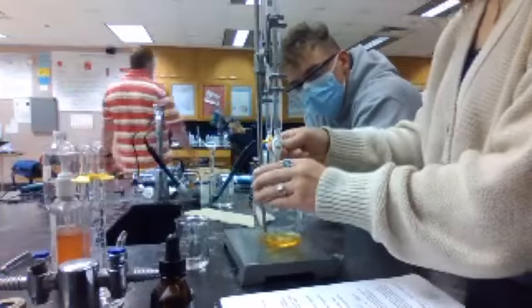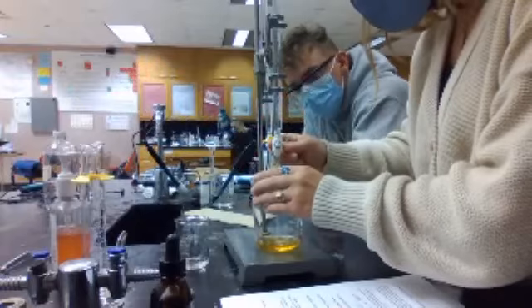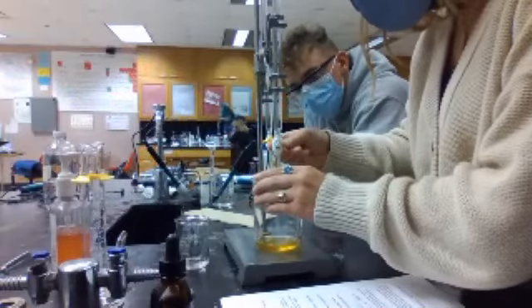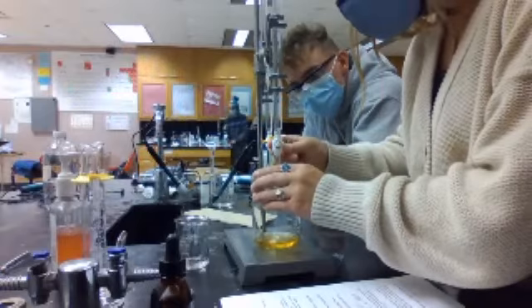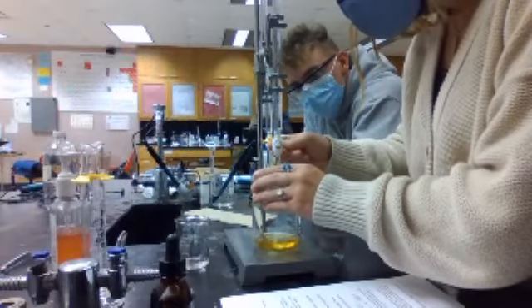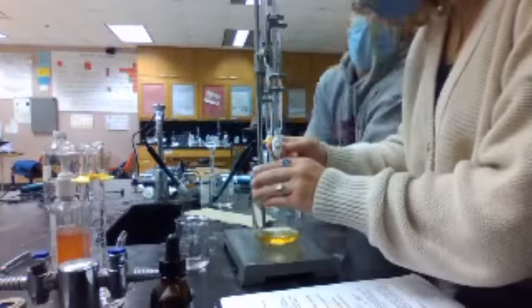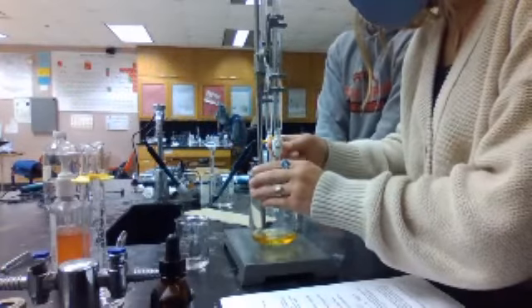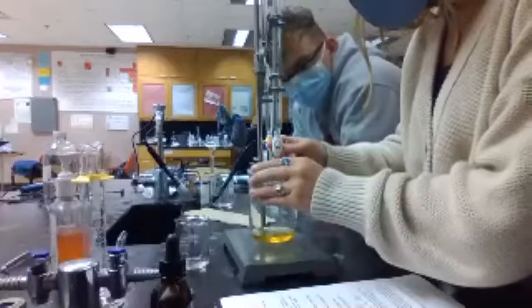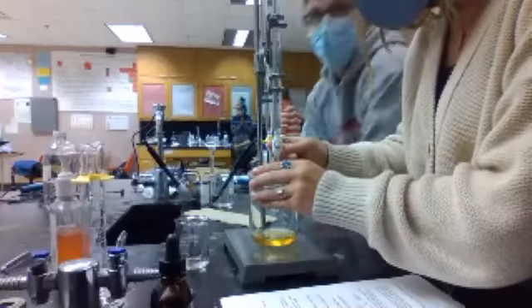Okay, so we did the first test, but we did not graph. Did the volume barely turn blue? Yeah, so this is probably not a good one. Is it close to what Gavin found to be the milliliters? Drop by drop, and once it started to look blue, there we go. Now get your final volume, and then you can figure out the volume of the base.